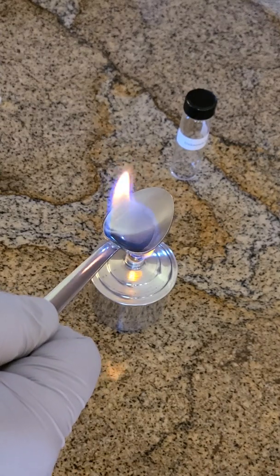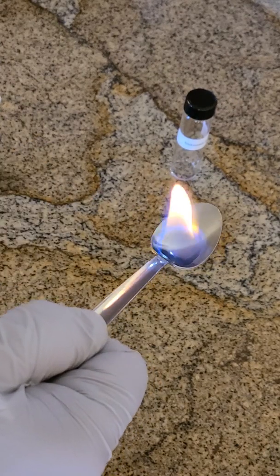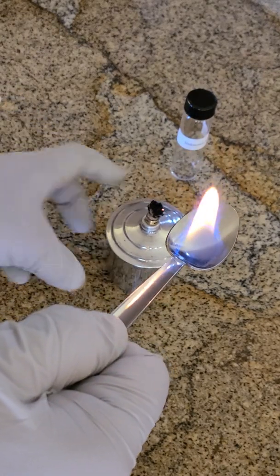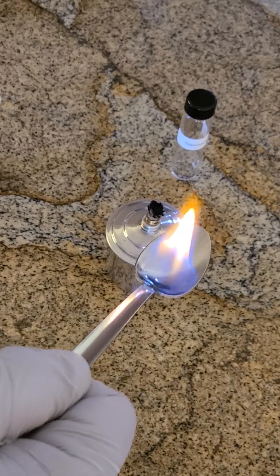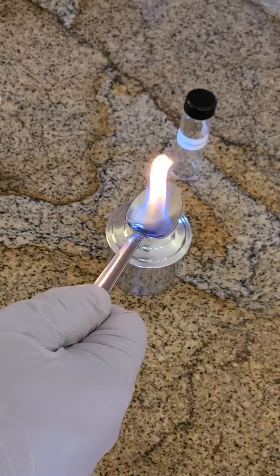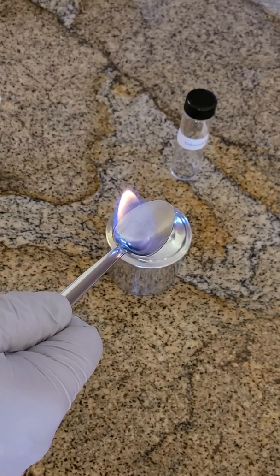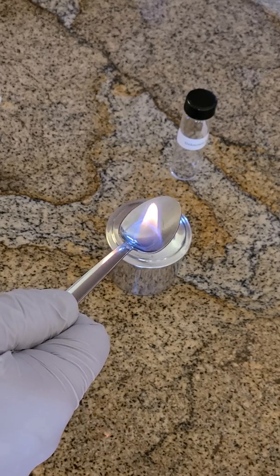Now you can leave it and let that burn. I'm going to go ahead and put this aside since the alcohol is burning on its own — I'll save my alcohol burner for future use. Pretty cool. Just let it go all the way until it completely combusts.